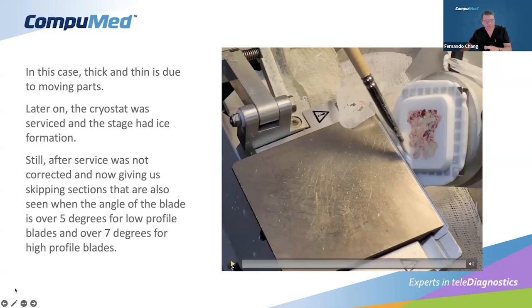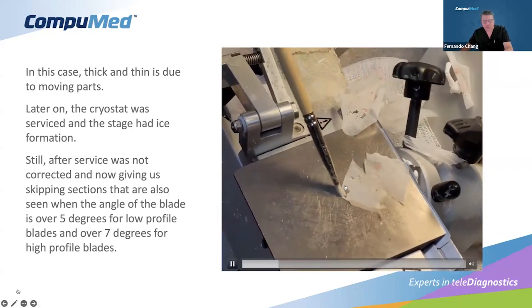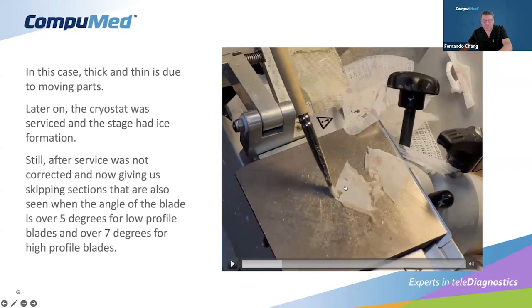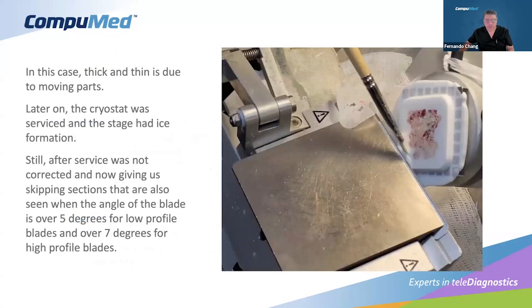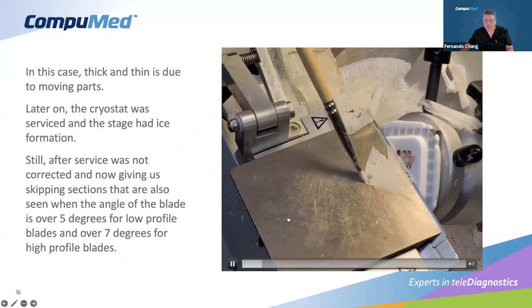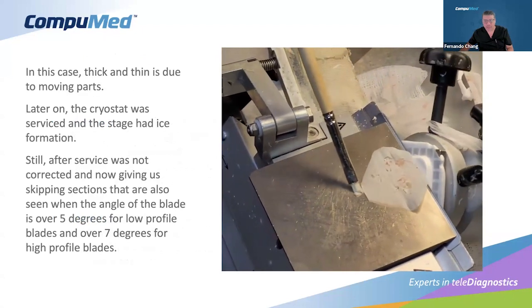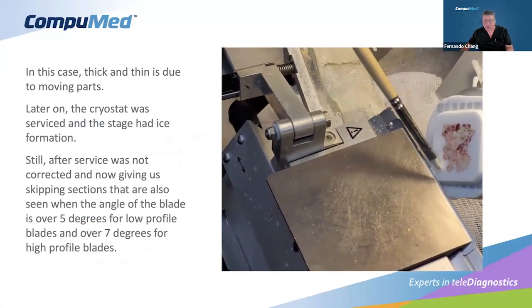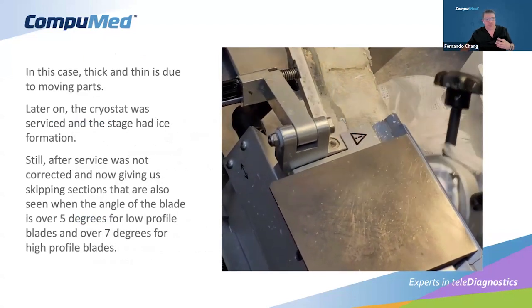But then we continued having problems. You see the consistency here. We're cutting, and this part is quite acceptable. All of a sudden, we don't have anything in the center where the sample is, and then we go back and we have part of the sample again, but you see that it's thick and thin. So we called service again, two different thicknesses anyway. The bottom was thicker, and so we needed to find out what was going on.